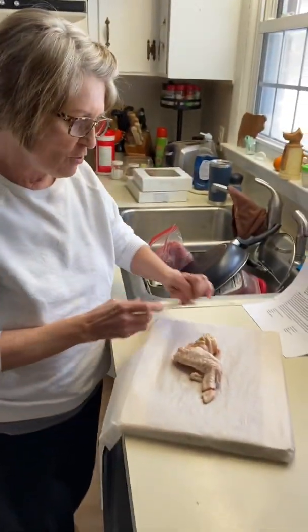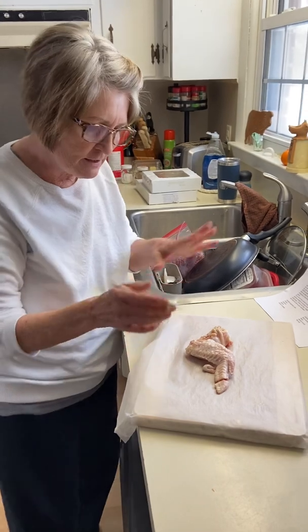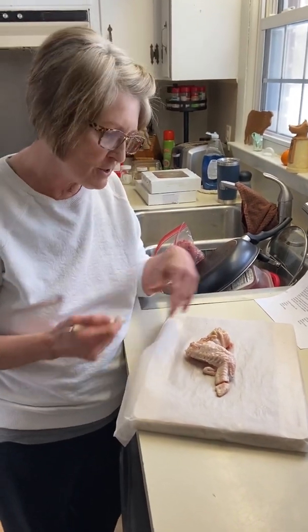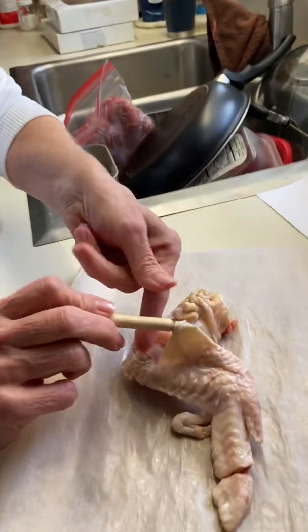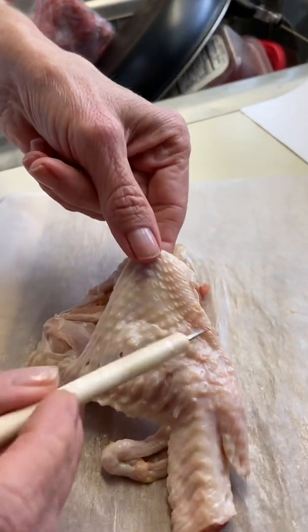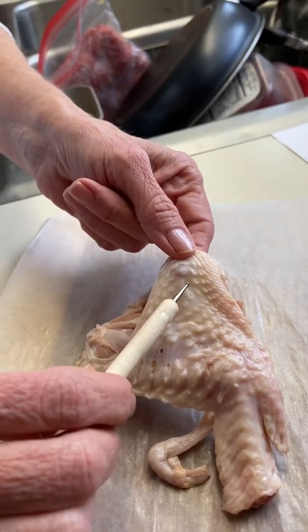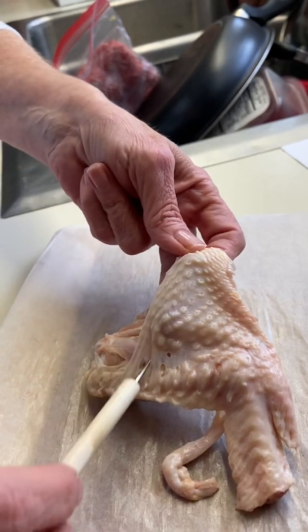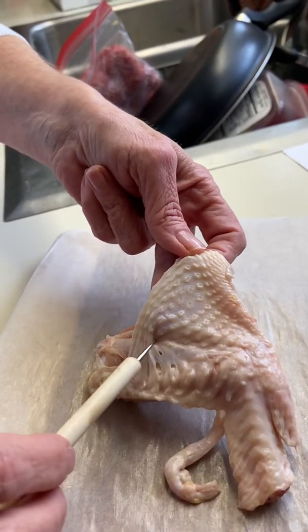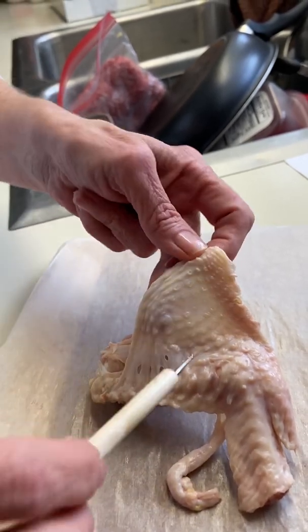All right, so on our chicken wing dissection assignment, I have pre-dissected, and so now I'm ready to identify my parts. To begin with, we're going to take a look at the chicken wing skin, and as you'll see here, this skin of stratified squamous tissue has multiple pores here, and these pores are reflective of where the chicken feathers would actually be attached. But again, like I said, the epithelial is of stratified squamous.